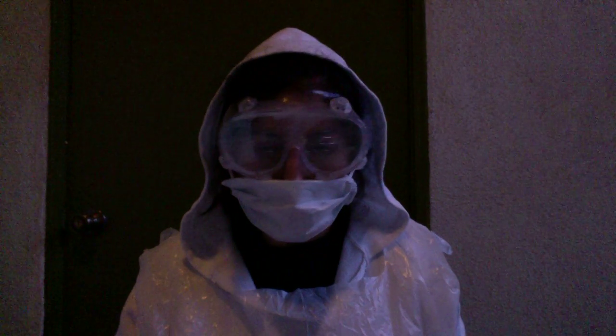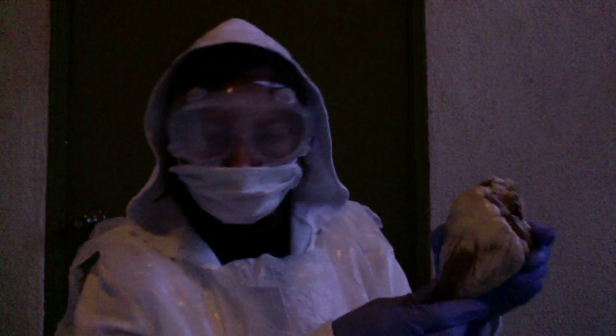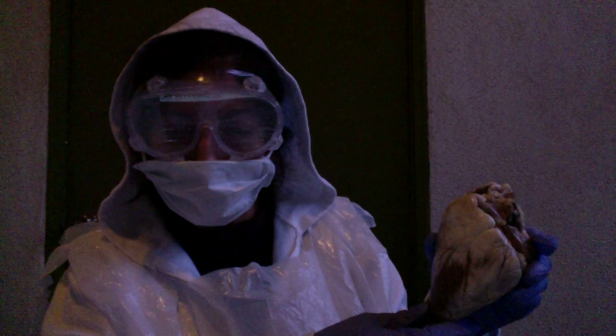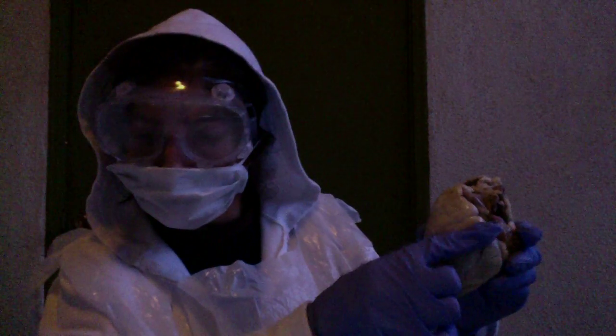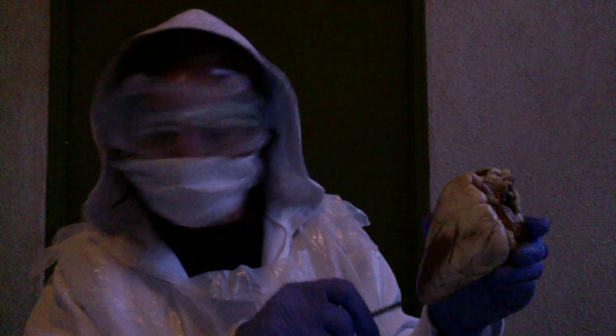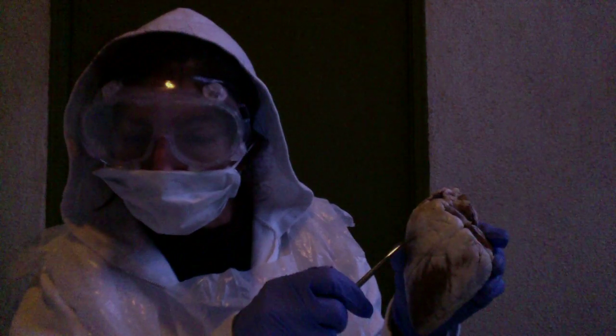It is for the sheep heart dissection video. I will be going over some of the external and internal parts of the sheep's heart. The visceral pericardium, the epicardium, is basically the outermost layer of the heart.